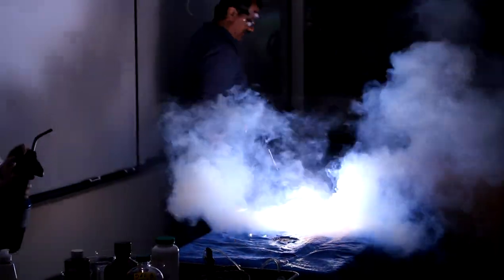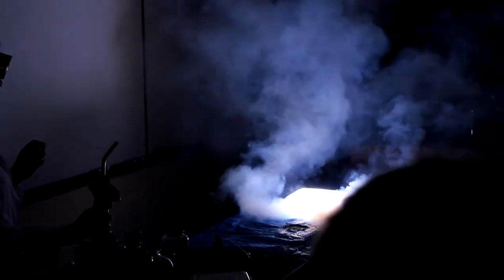Now does it look like it's putting my fire out? No! It's not putting my fire out.